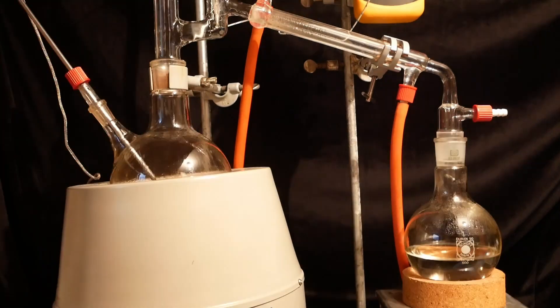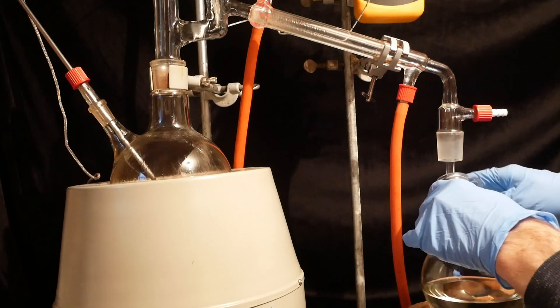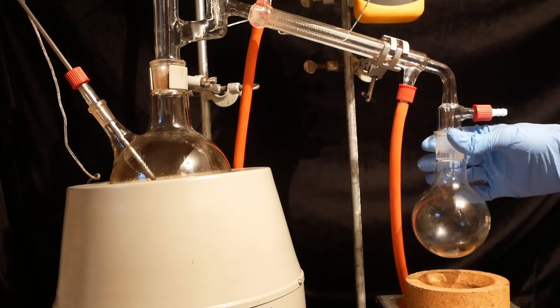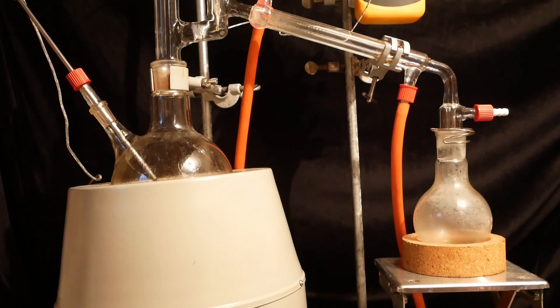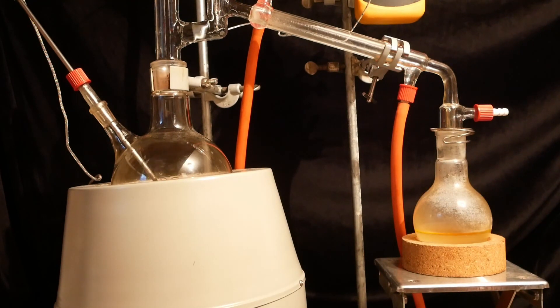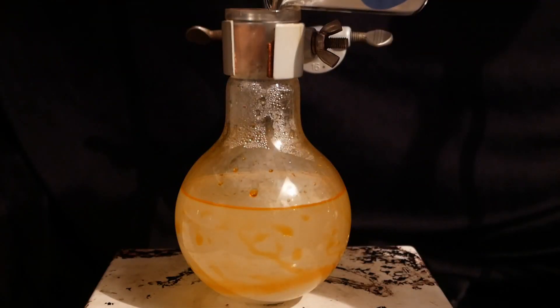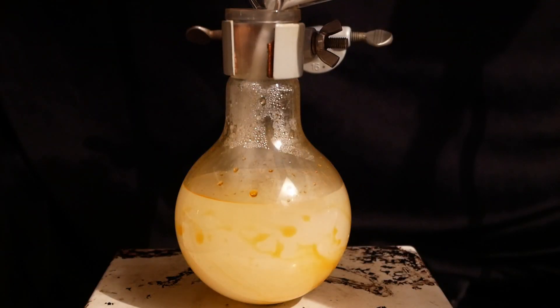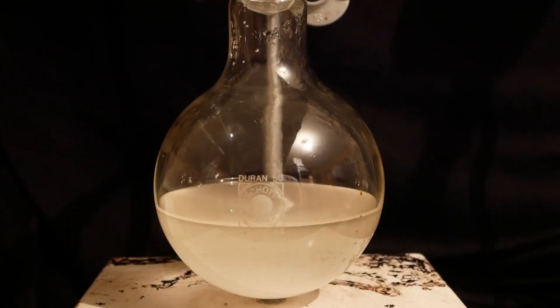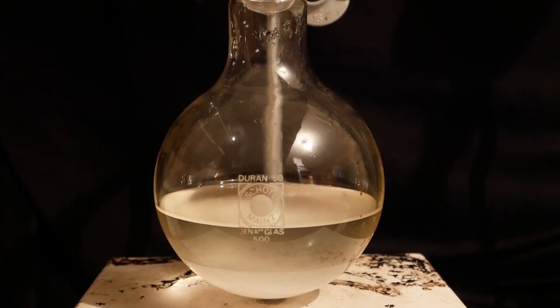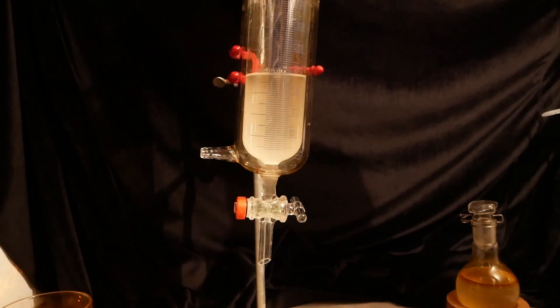Then when the temperature approaches 100°C, I swap out the flask to a new one and collect the aniline-water azeotrope. The workup is the same as before. Add salt to the aniline fraction to salt out as much as possible. In addition to that, I also salted out the dioxane, as it might also contain some product. I then separate the dioxane and put it in a separate beaker.